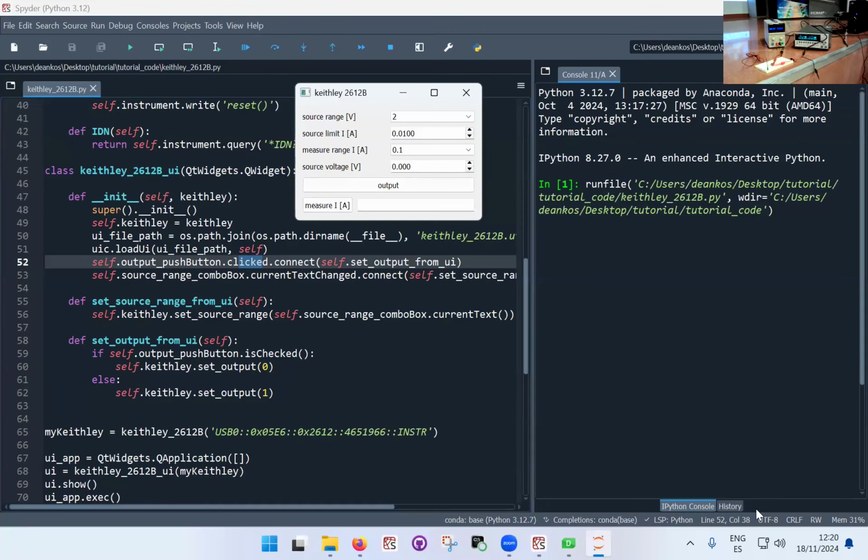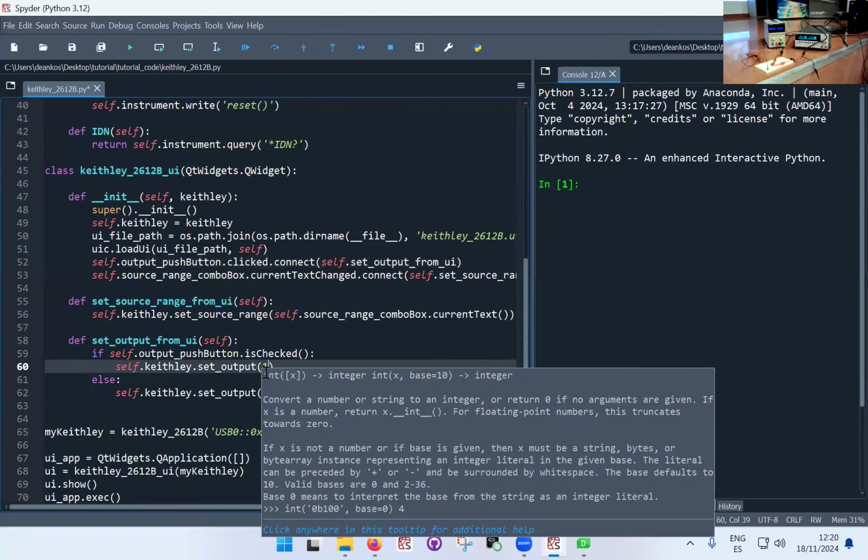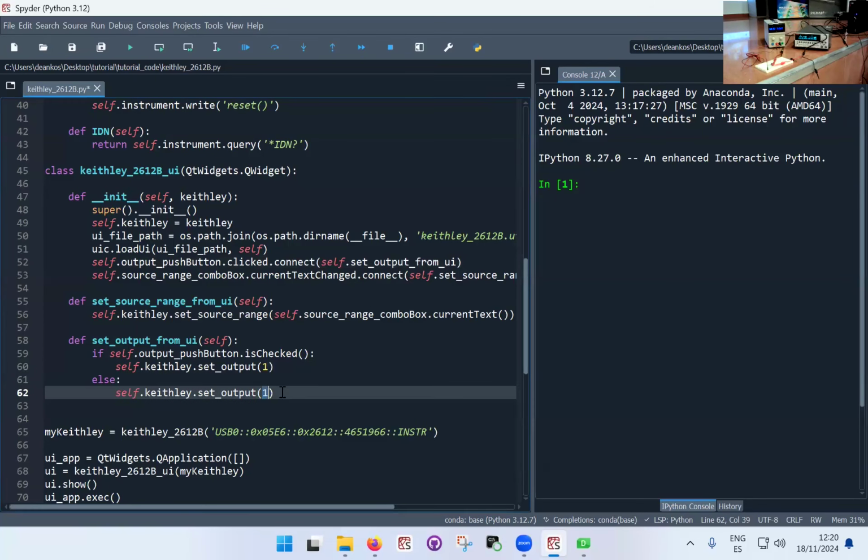Okay, let's keep an eye on the output LED. So if I click this, I probably implemented it the wrong way around. So the output is now supposed to be off. You can see that I can turn it on and off, but what I've done is I programmed it wrong. So I'm going to close this down, because now, of course, once I click, the button has changed its state. Okay, so if the button is in the on state, I need to turn the Keithley on. So what I implemented is kind of like a toggle: turn it on, if it's on, turn it off.